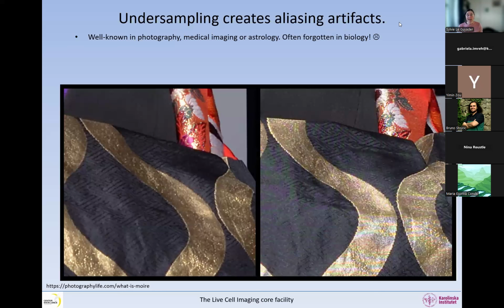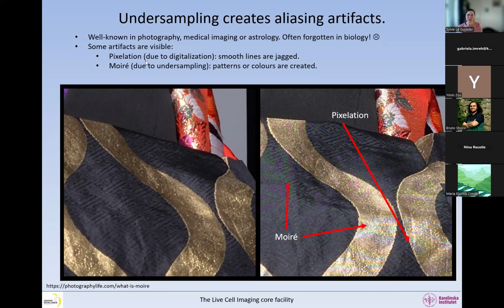Undersampling creates aliasing artifacts. This is a well-known thing in photography and in medical imaging and in astronomy. But somehow in biology, we just pretend it's not there. And that's a pity. Some artifacts are visible, for example, pixelation. You can see in here this very nice curve. This curve that is very smooth in the cloth is actually jagged. And this is pixelation. This is the fact that we're digitalizing something that is curved, so we start seeing the little squares on the edges.